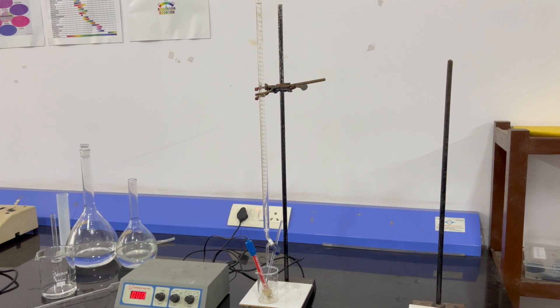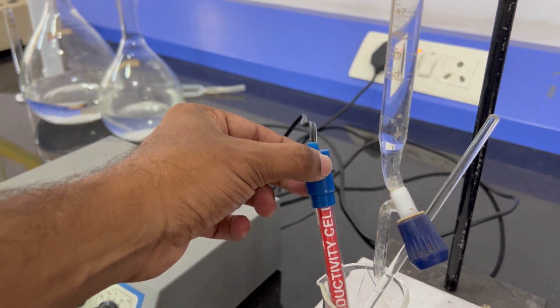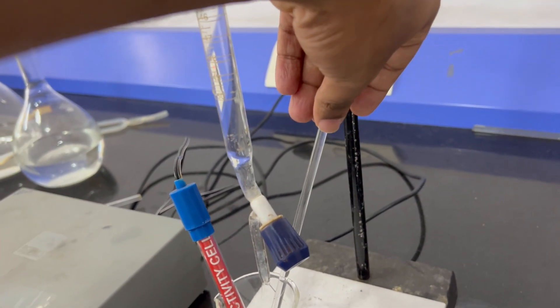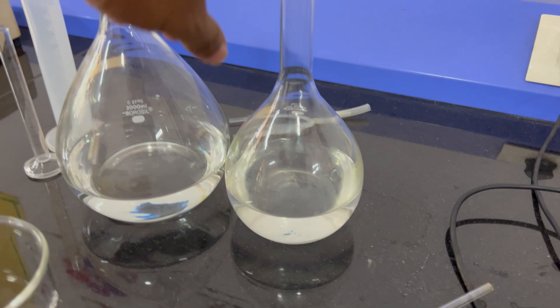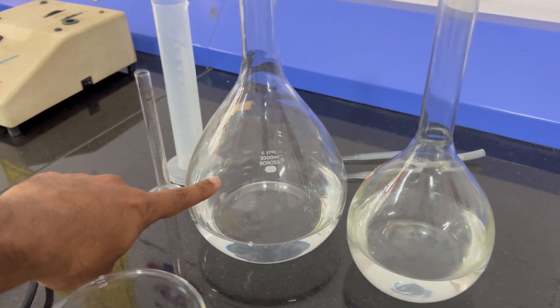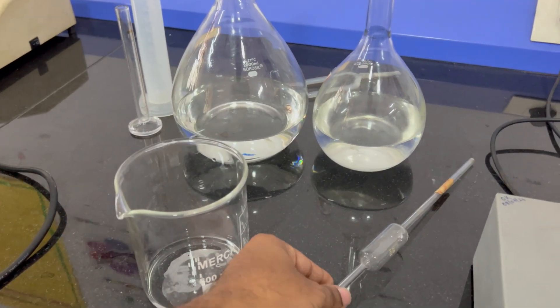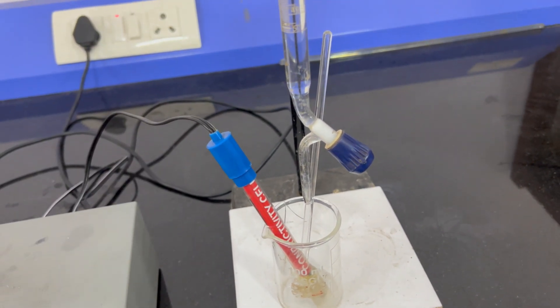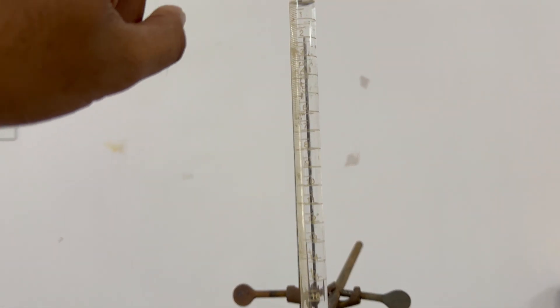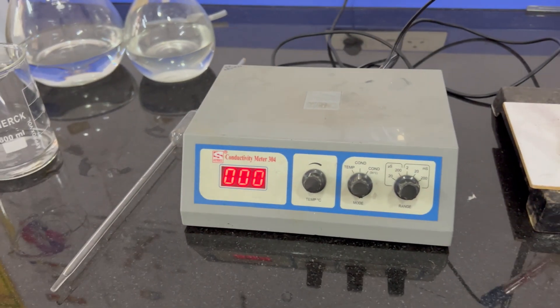The basic instruments we need: one is a burette — you can see the burette here. Then a small beaker and our conductometric instrument. Here we are going to place the base, and from the burette we are going to add the acid. We have to take the solution and drop it into the beaker with the base.